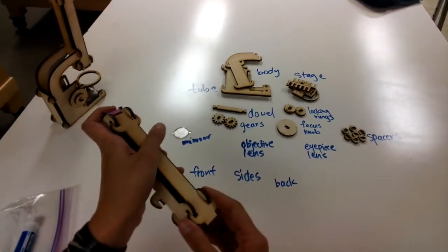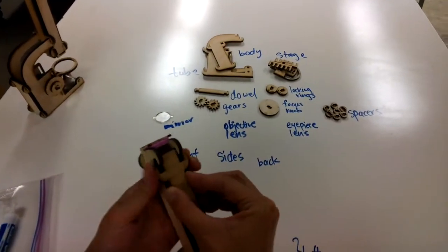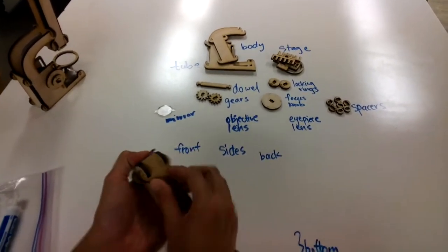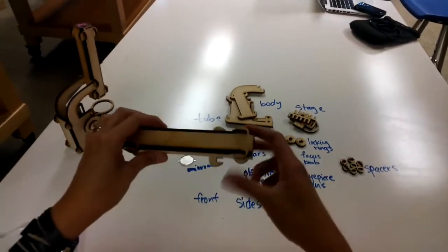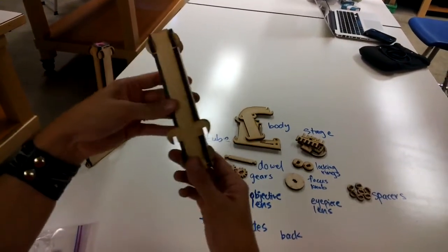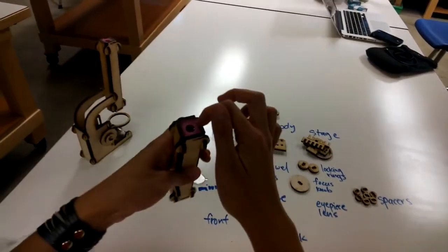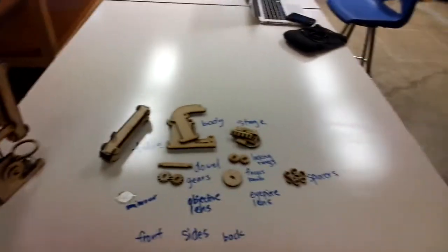So add on the front piece of the tube, and it should hopefully slot on a little bit easier than what I'm trying to do here. There we go. And you've got the tube completed. Okay, so again, here's the top, here's the bottom, here's the objective lens, here's the eyepiece lens. Okay, the next thing we're going to do is the stage.